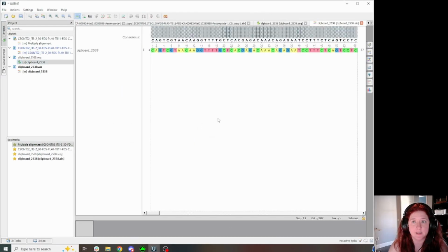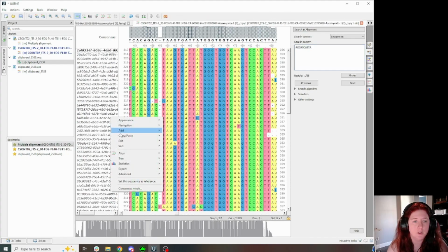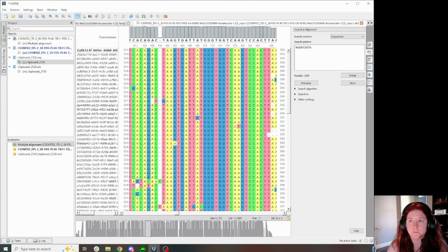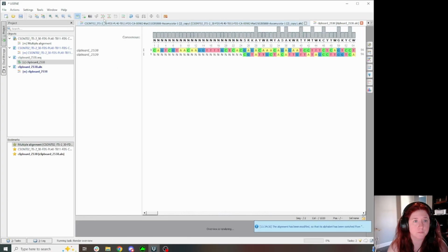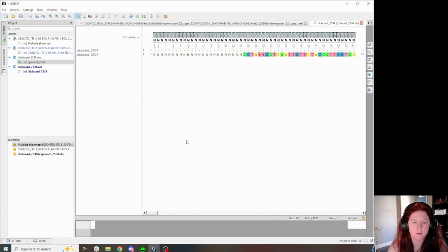We're going to do a quick comparison to some of the other sequences to see where they're falling and how well they align in UGENE. So let me just double check my ambiguities. Don't think there are any, but okay, yeah. So we don't have any ambiguities here.